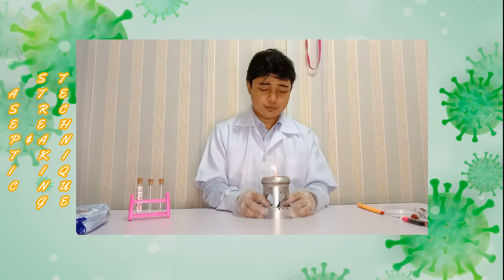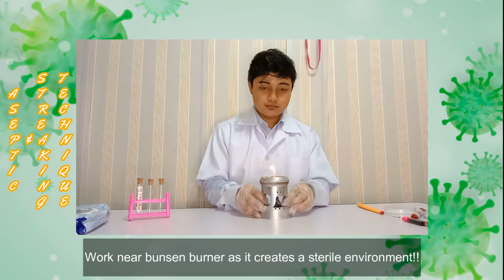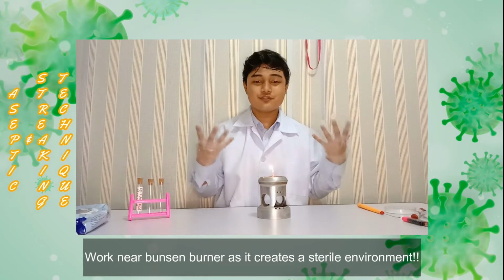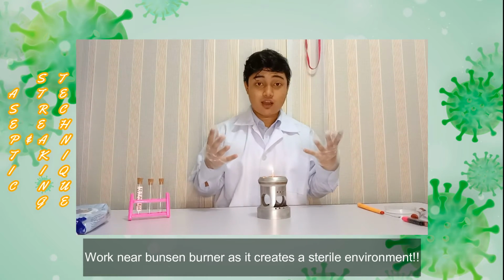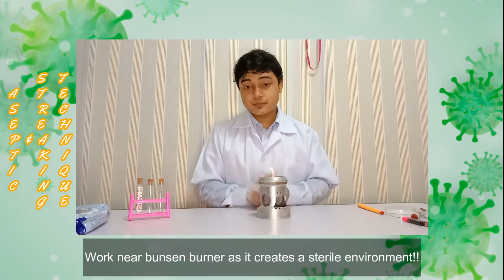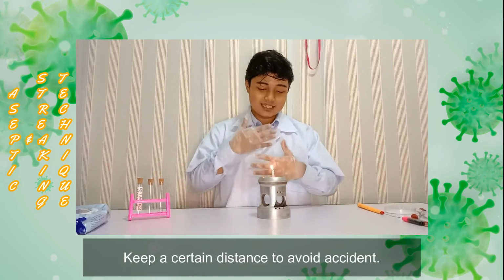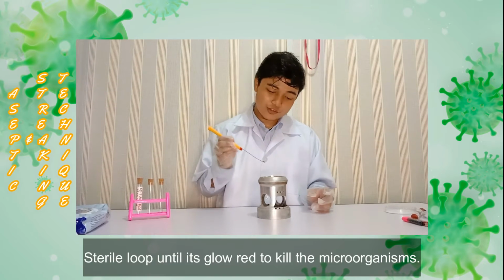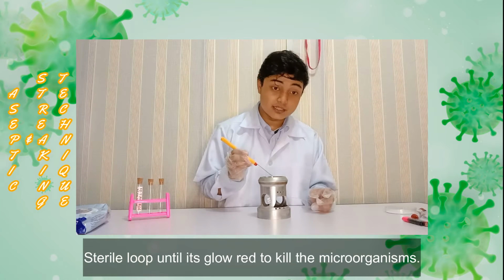It is very important to work near the Bunsen burner because it creates a sterile environment for our experiment, but make sure to keep a certain distance so that we can avoid any accident.